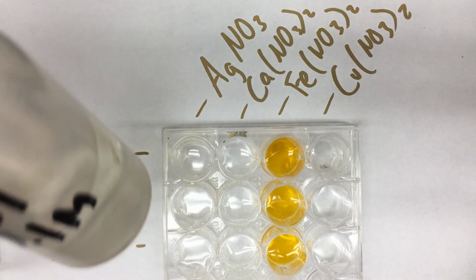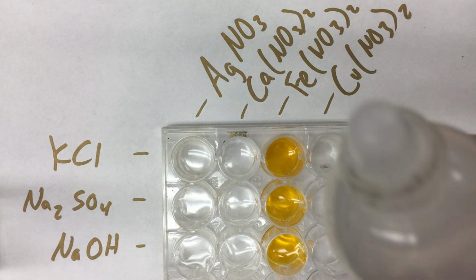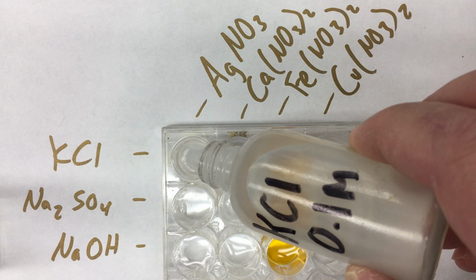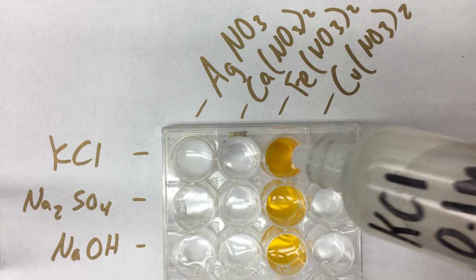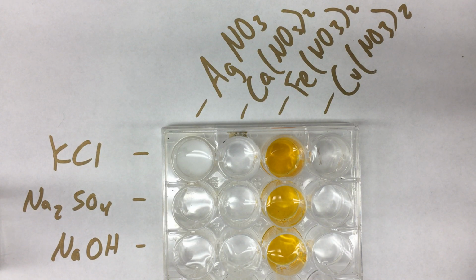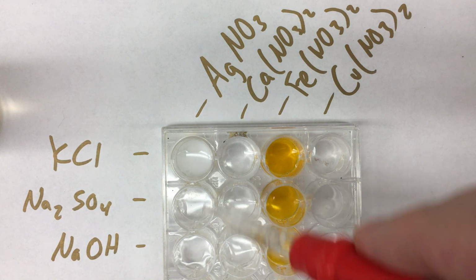Now in order to get the 12 different reactions to take place, all I do is take some of each of the reagents, first potassium chloride, and we put some potassium chloride in each of the columns on the first row. Potassium chloride is also a clear and colorless solution, so you'll be able to see if any kind of reaction takes place. If a reaction takes place, a solid precipitate will form. And I'll show you both against the white background as well as against a black background. Sometimes it's difficult to tell if a precipitate forms against the white background, but the white background is useful to be able to see color and not useful to be able to see transparency.